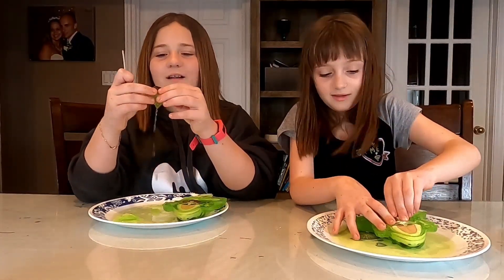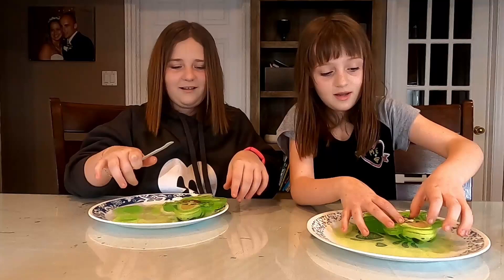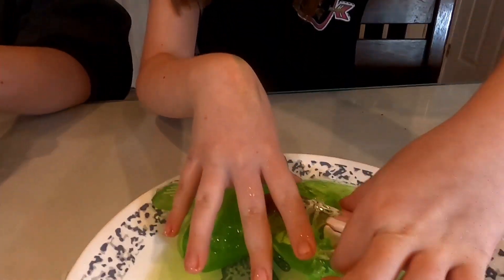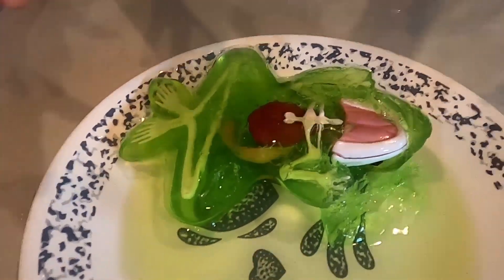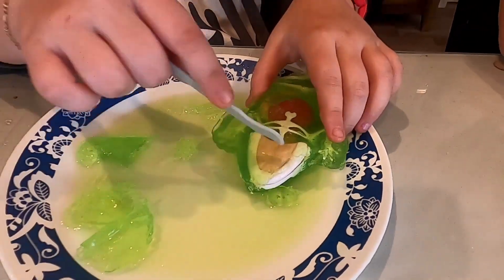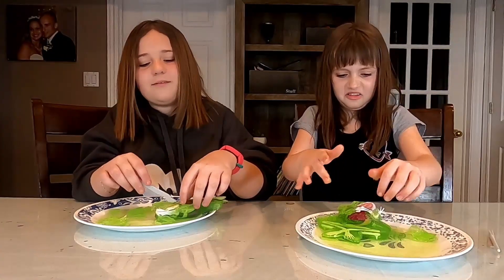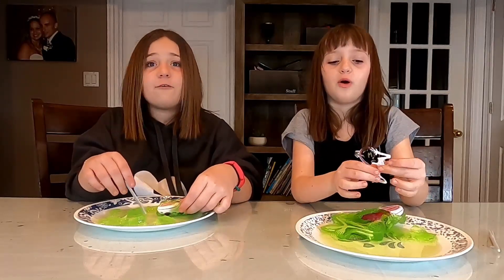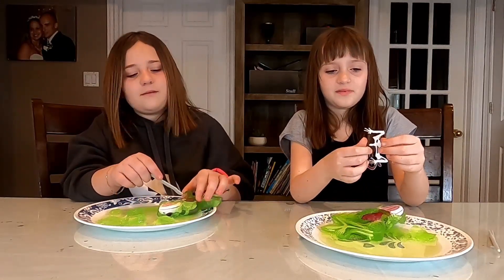Look at this — it's gel. We're going to give you a quick close-up on the frogs. Want to move your fingers for a second? Mine's like falling apart. There's Alyssa — she's got a skeleton almost removed right now. It's so gross. What does it feel like? It feels like a real frog. It's pretty slimy.